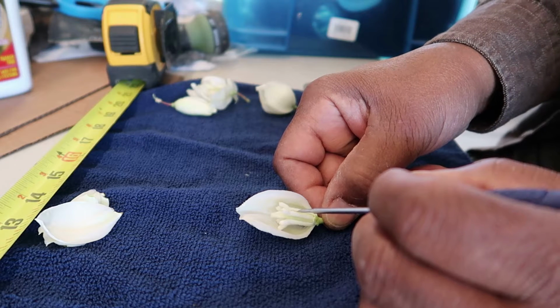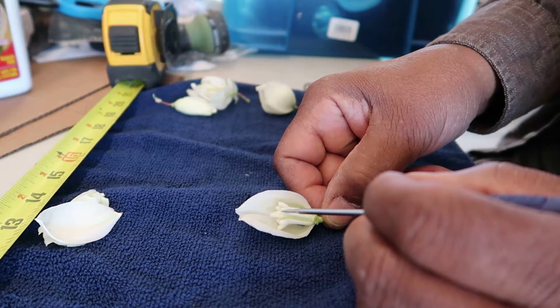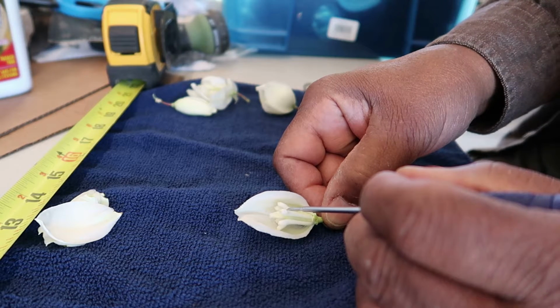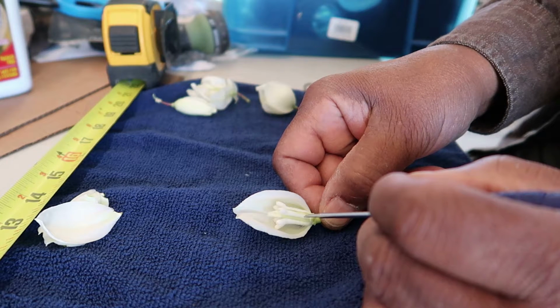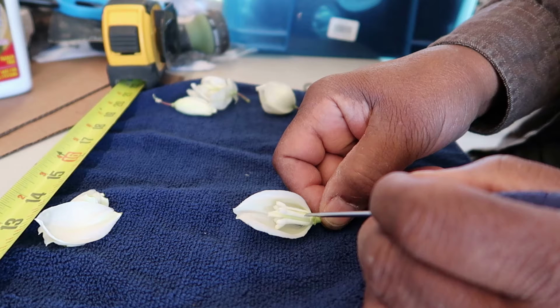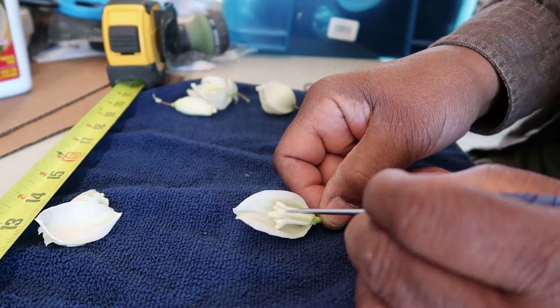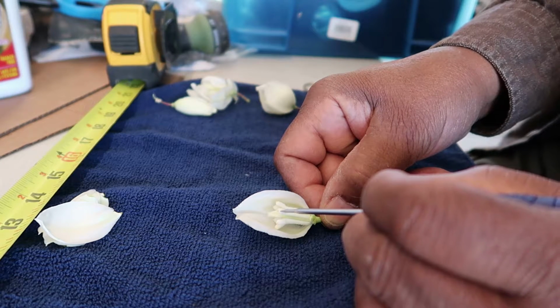There are 6 stamen in this area. They are recognized by 2 parts. Well, actually 3. This little bit of pollen at the end, the anther, and the filament. The pollen particles are made in this anther, and then they are extruded at the tip of the anther.